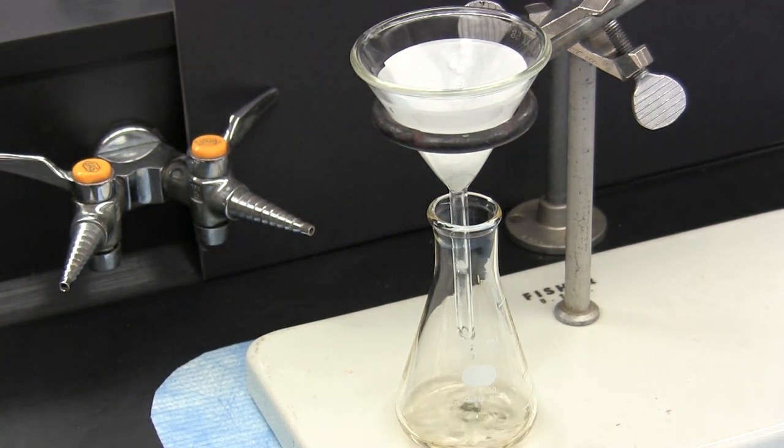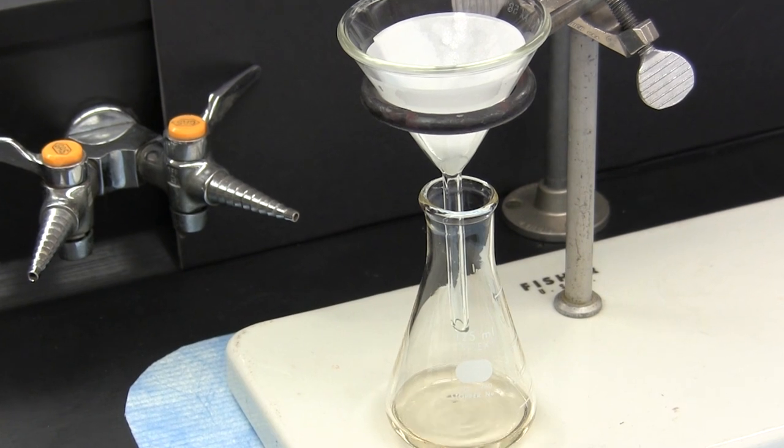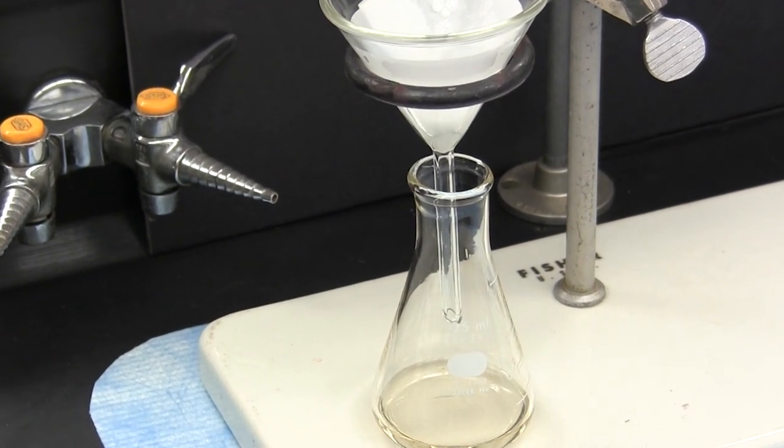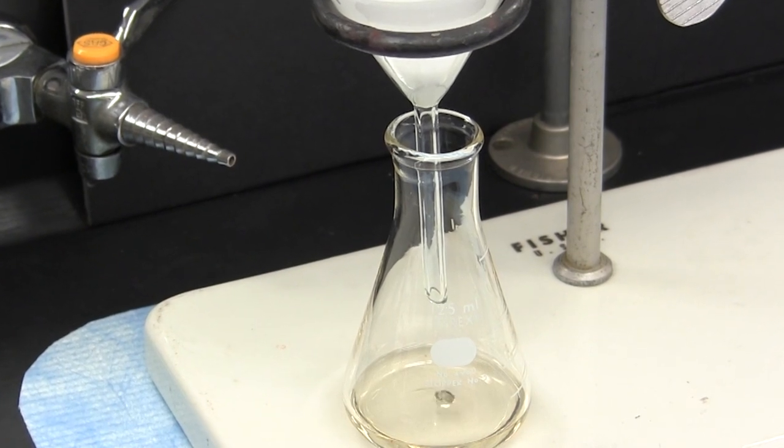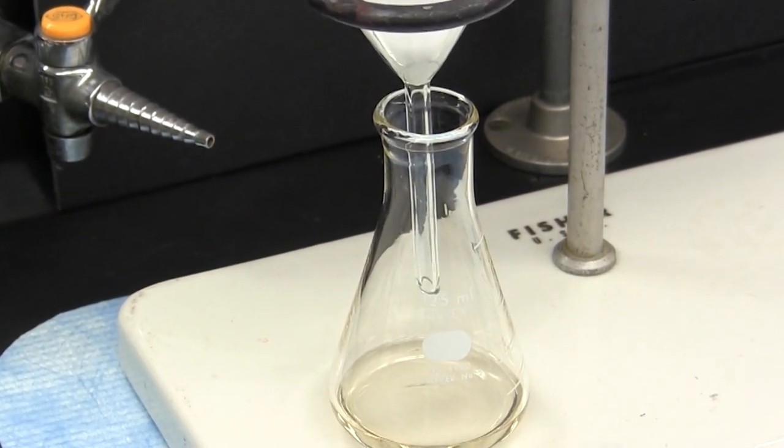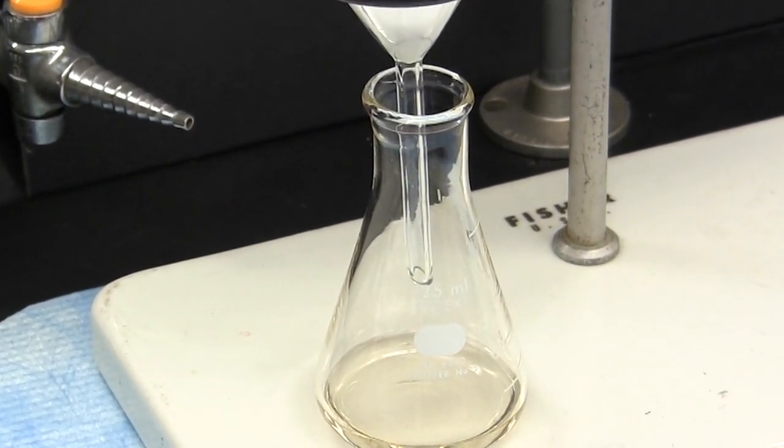So that's about it for solvent extraction in this video. Remember that we've had a look at only the basic procedures, so it's important for you to follow the directions given in your lab manual and by your lab instructor for any specific experiment which involves solvent extraction.